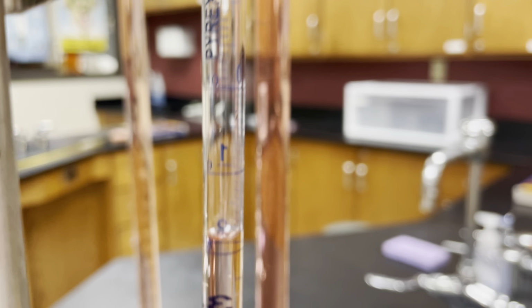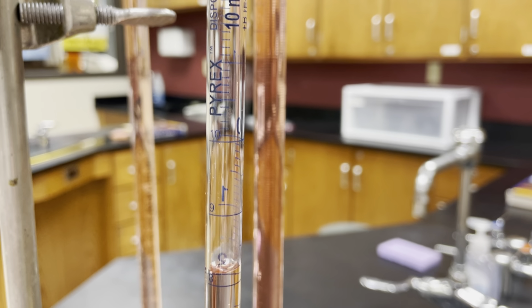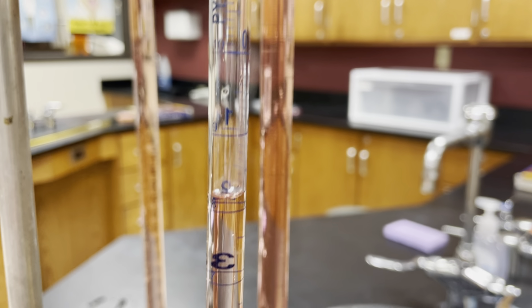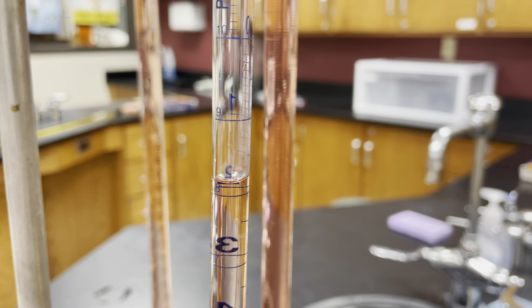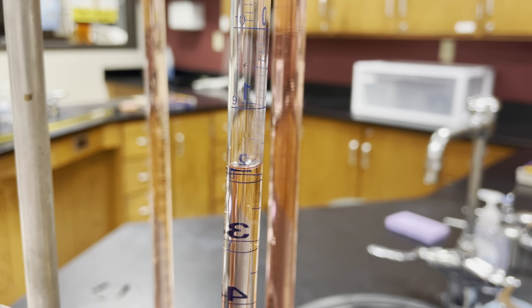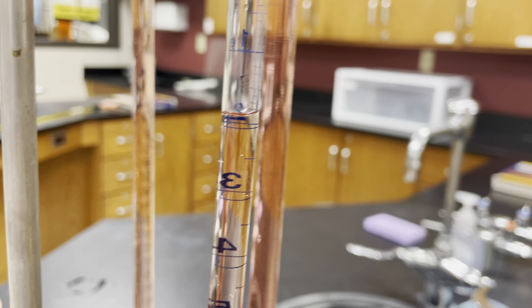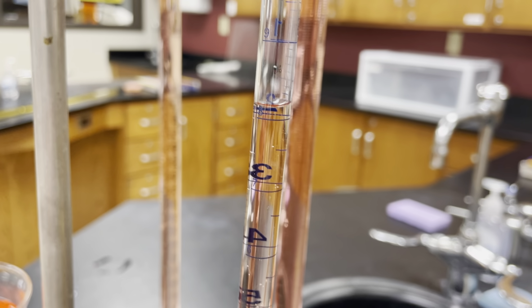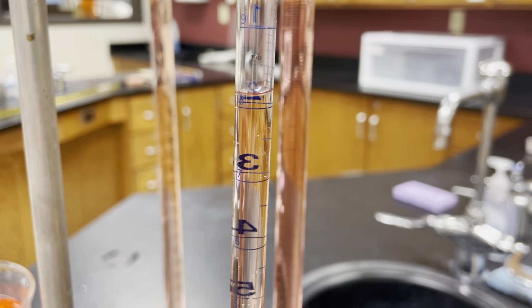Again, it's hard to show that, because the glass is translucent, and you'd be able to see it better if you had it in front of your own eyes. But this is one way to show it. As you're looking at an angle, you can see them on the right, but they're not on the left. So looking from the front, you can see the marks on the back, but they might not correlate well to the front. So we probably don't want to use this for any measurements where we need to know something like 9.5 milliliters. A graduated cylinder might be best suited for that. But if we need exactly 9 or 10 milliliters on the dot, then this would probably be okay.